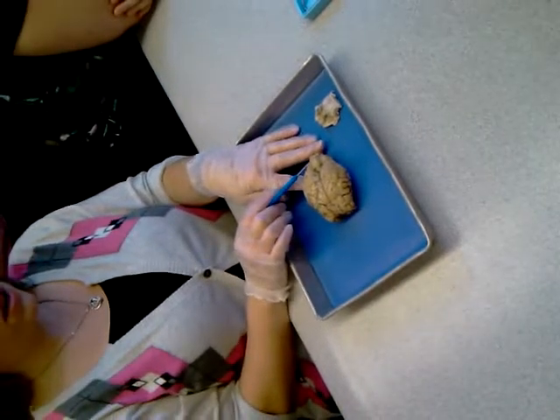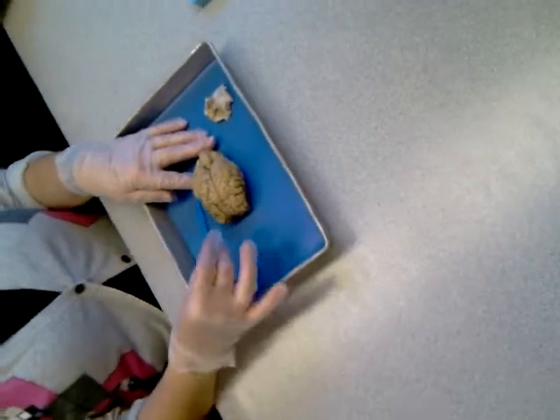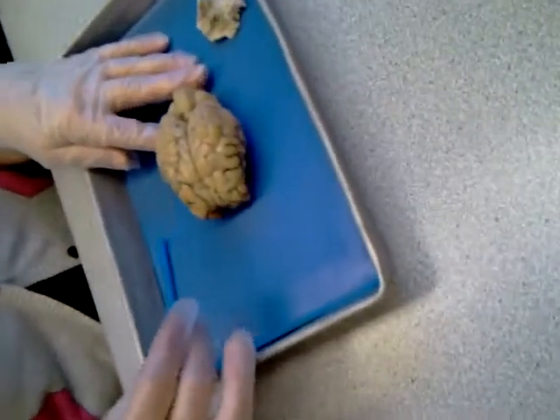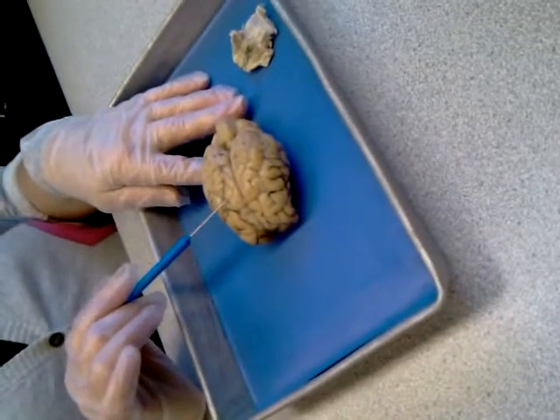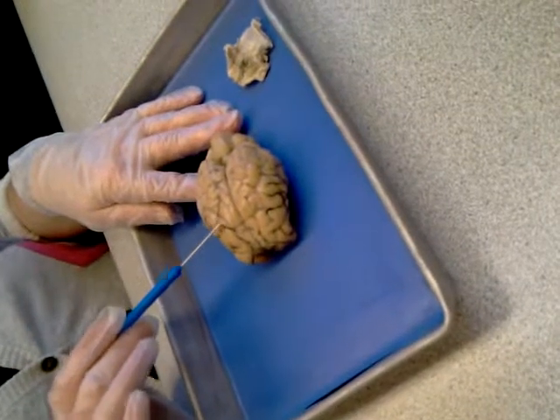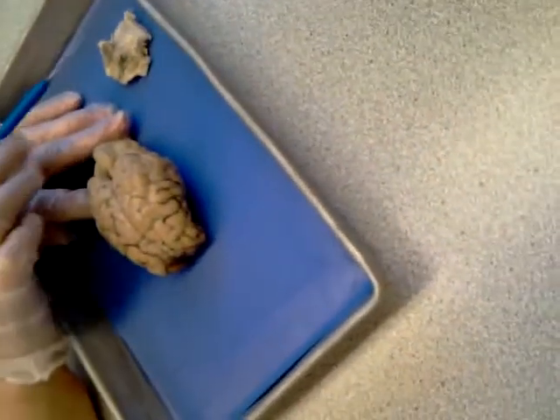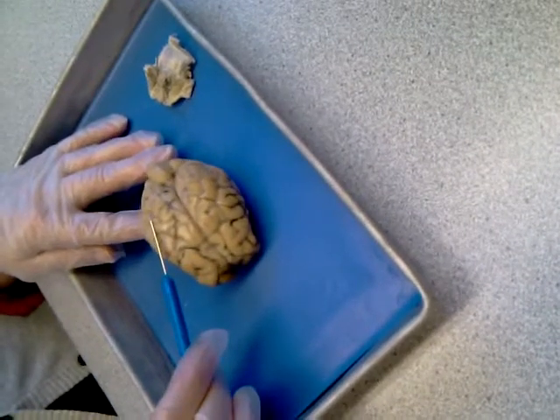Cerebrum? This one? Cerebellum. What is this half called here? This entire half. Hemisphere? Yes, very good. The hemisphere. What are the raised areas called? Gyrus is singular, gyri plural, and then the groove? Sulcus or sulci. So we have the dura mater there. Can you name this membrane?